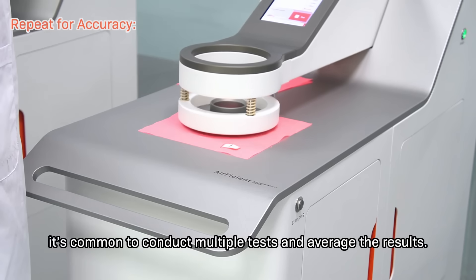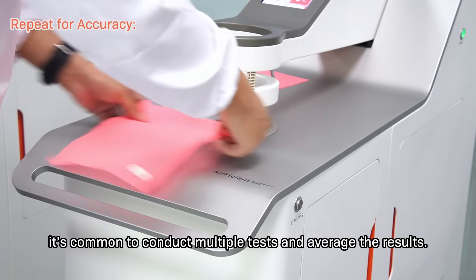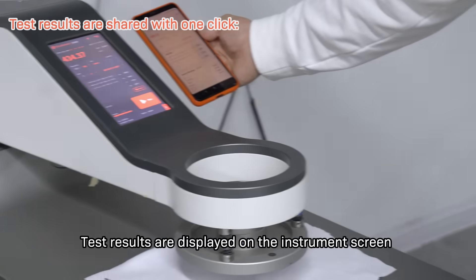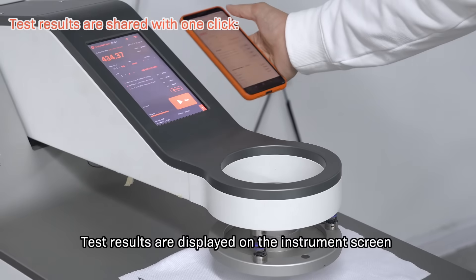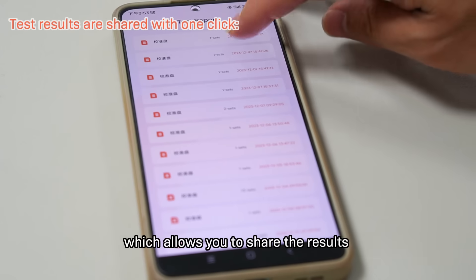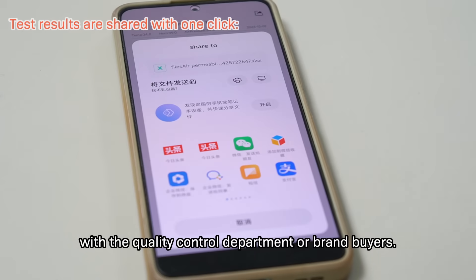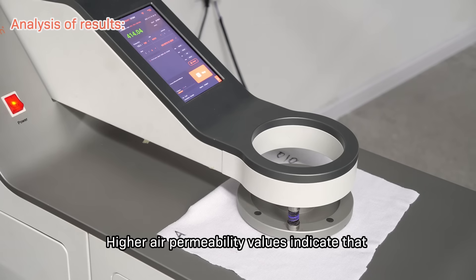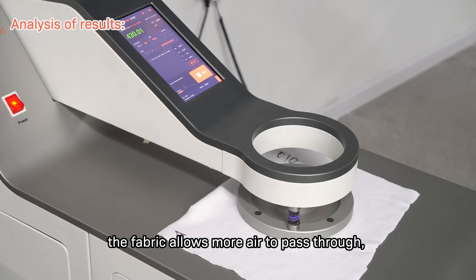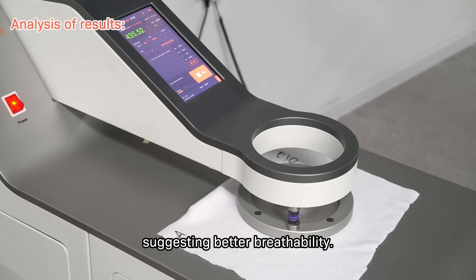For accurate results, it is common to conduct multiple tests and average the results. Test results are displayed on the instrument screen and can also be viewed on your smartphone, which allows you to share the results with the quality control department or brand buyers. High air permeability values indicate that the fabric allows more air to pass through, suggesting better breathability.